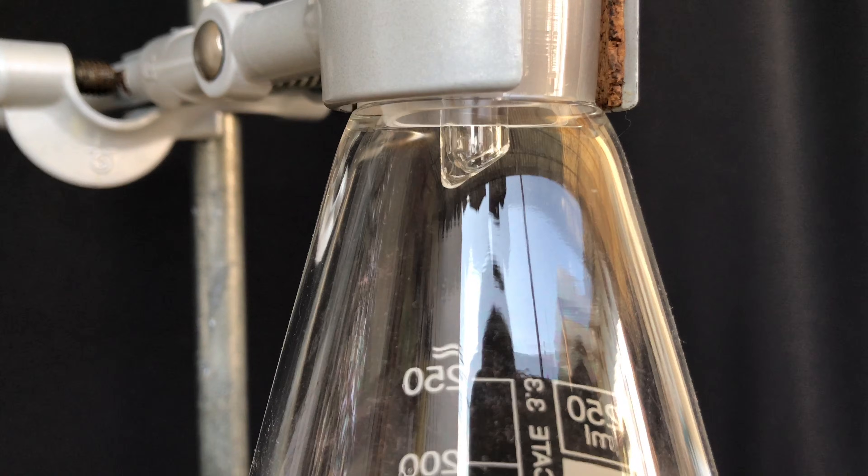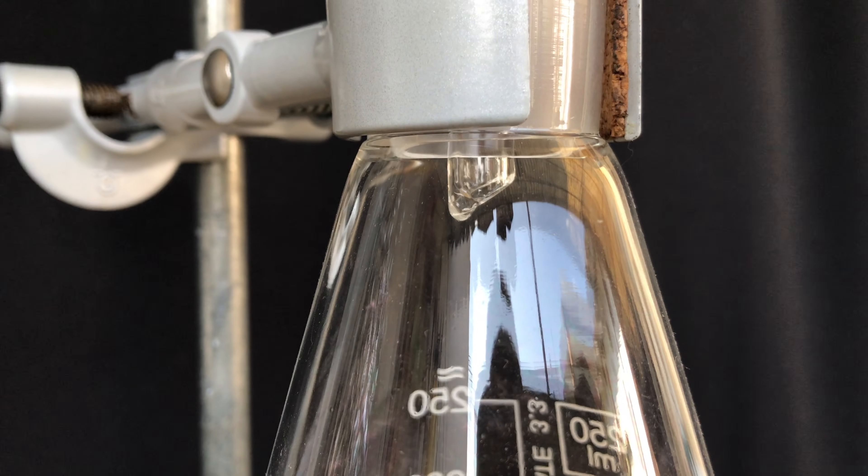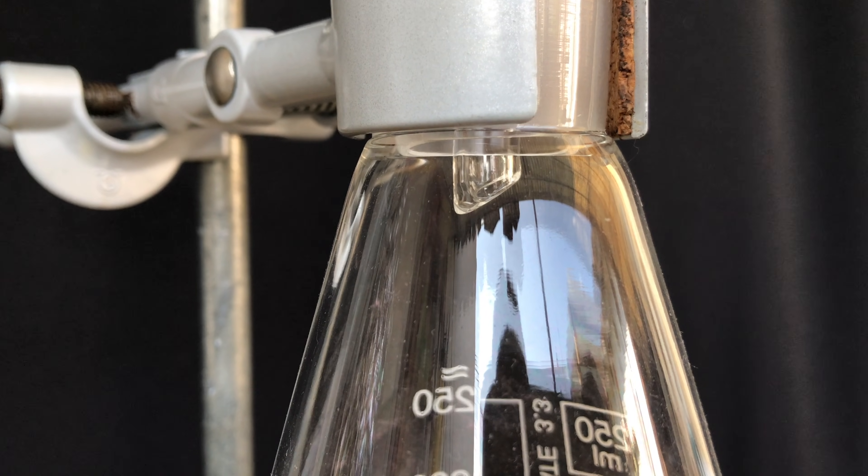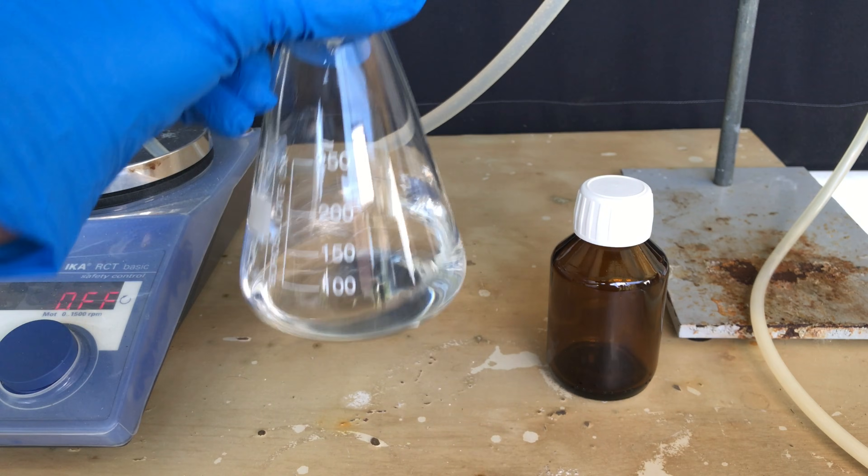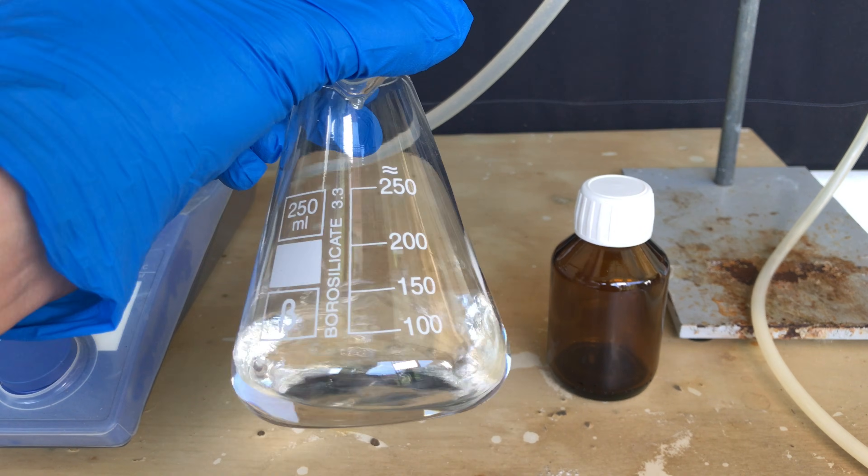I could have continued it to get an even higher yield, but I figured out that it wasn't worth it and I just stopped it. And there you have it, this is our finished propionyl chloride.